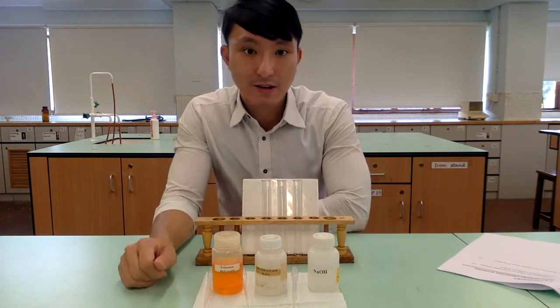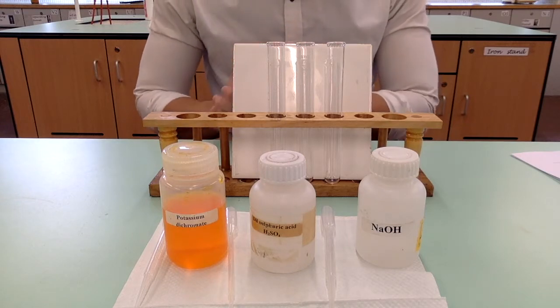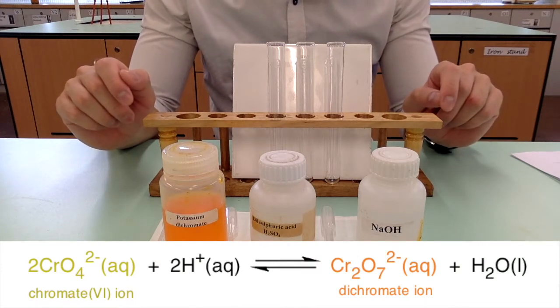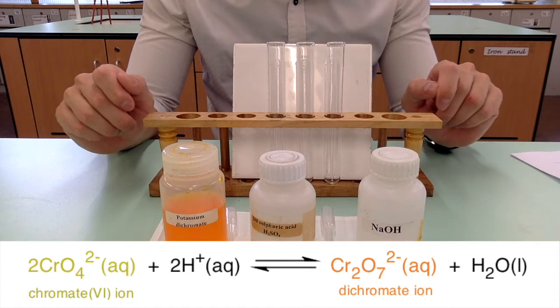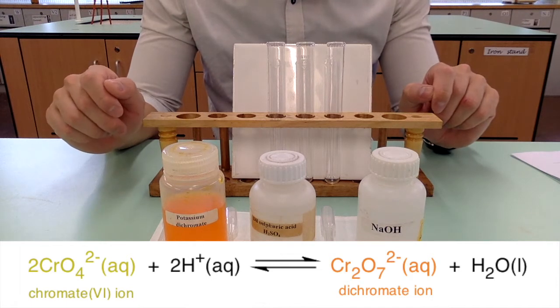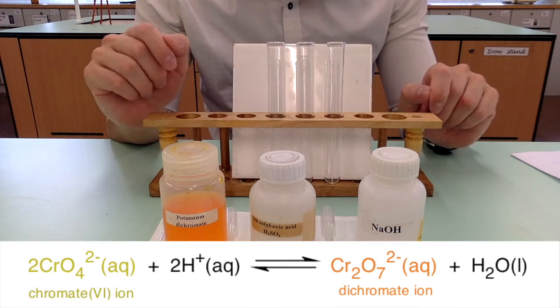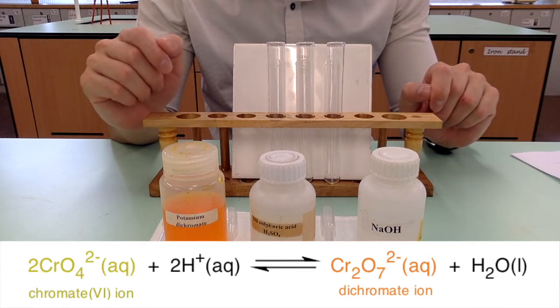The first chemical equilibrium system I am going to show you involves chromate ion and dichromate ion. The chromate ion on the left-hand side has a yellow color. It will react with two H+ to form dichromate ion and water. Dichromate ion has an orange color. We are going to change the concentration of hydrogen ion and see how it affects the equilibrium position and therefore the color of the reaction mixture.